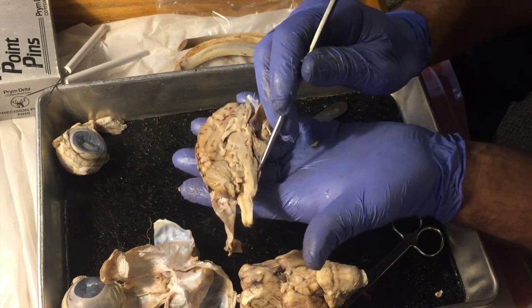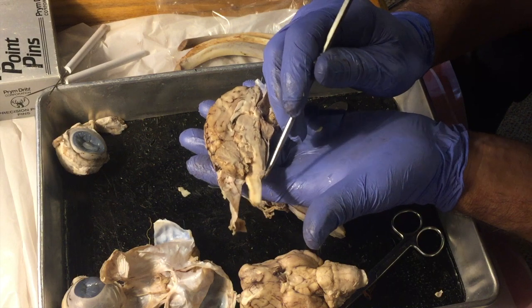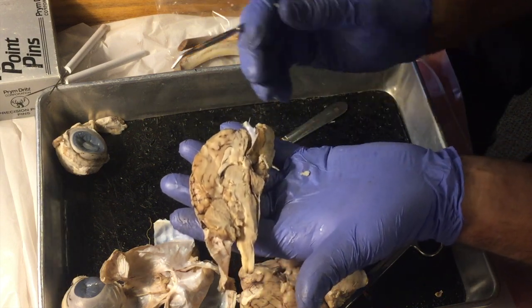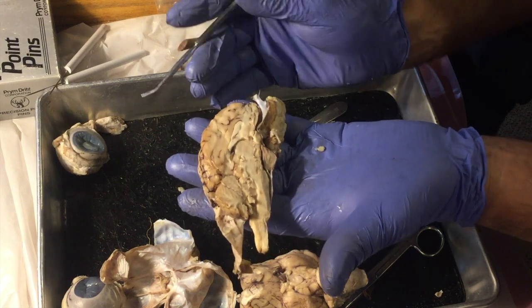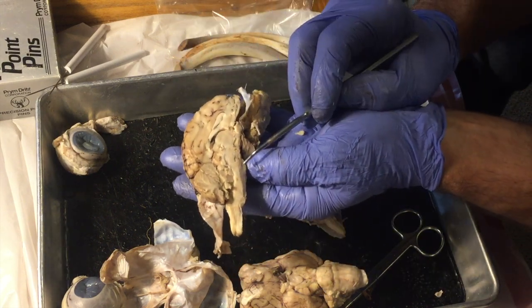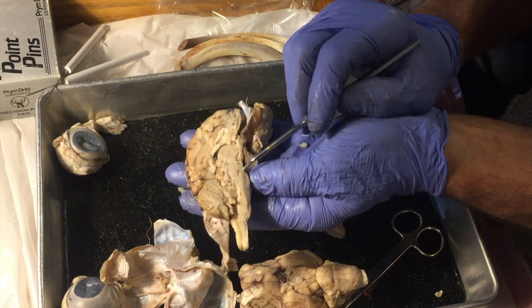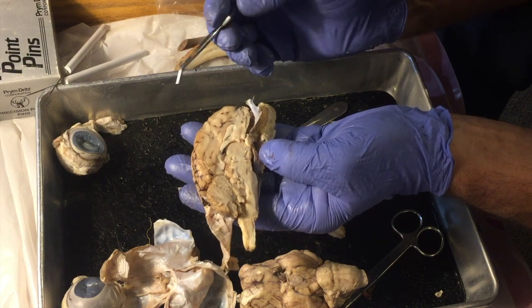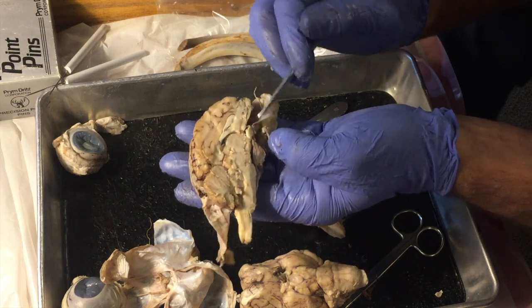So then we have a bulge right here. This is the pons, the medulla oblongata, and the spinal cord. And these structures are sort of switching tracks, switching centers, which decide where certain stimuli are sent, what to do with them, that kind of thing. Okay. All right.